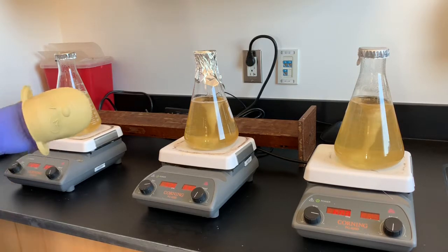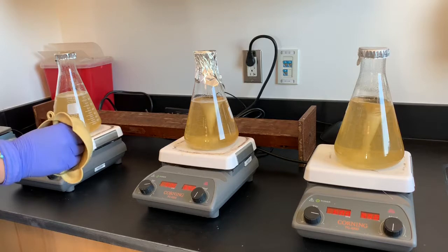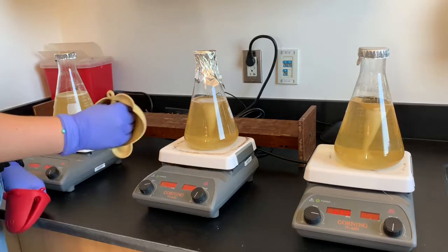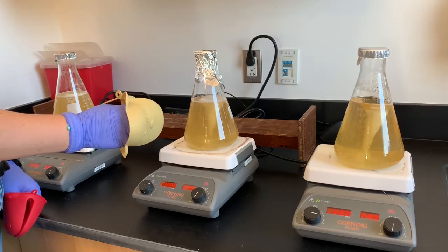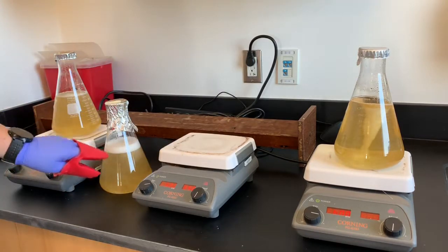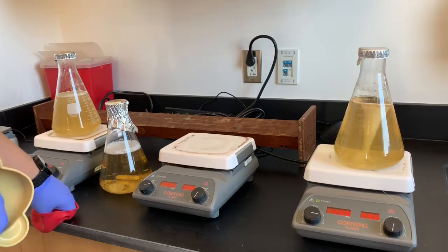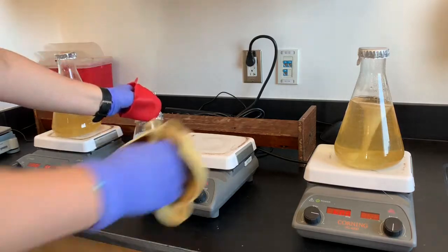It's getting ready to boil. Make sure you look at the other two as well at the same time. The white is almost ready — it's about boiling. You'll see the froth will go up when it boils. Now I'm going to take it off and see how the froth goes up. If it gets too close, I'm going to compress the lid like this, and it may go down without overflowing — so it relieves the pressure. That is the boiling, and now it's stopped boiling. Looks like beer, right? That's going to be ready to go.